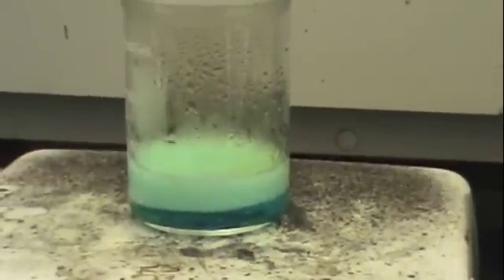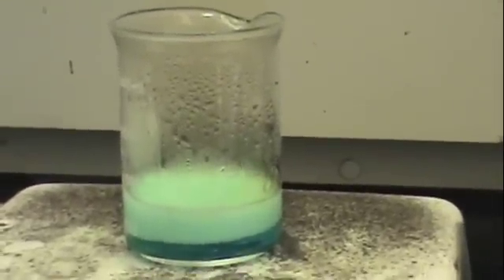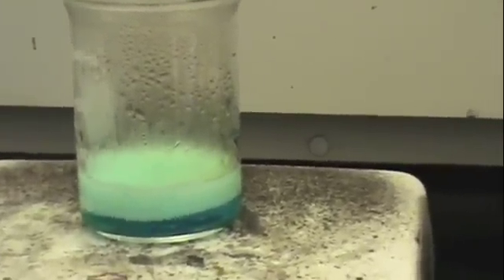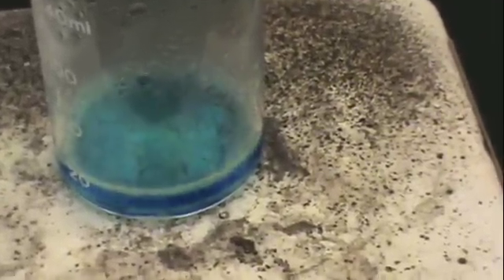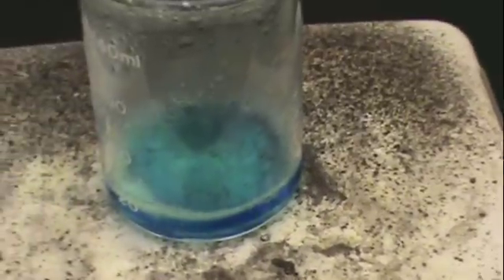As the reaction continues, the solution becomes deeper blue in color and continues to bubble vigorously as more NO2 is released. When the reaction is almost complete, you will see that the copper is almost completely dissolved.